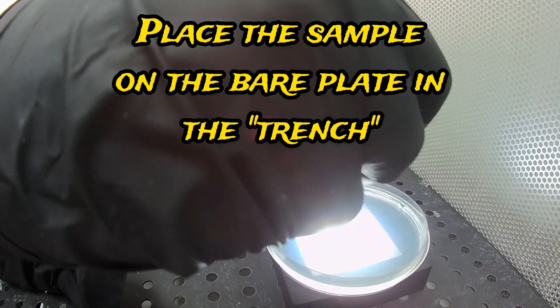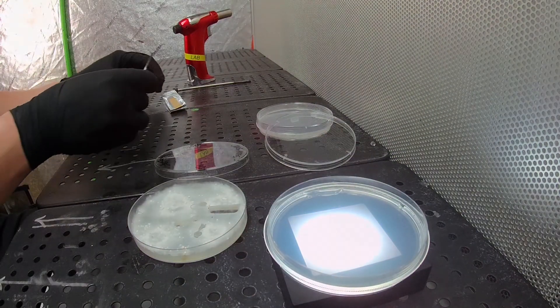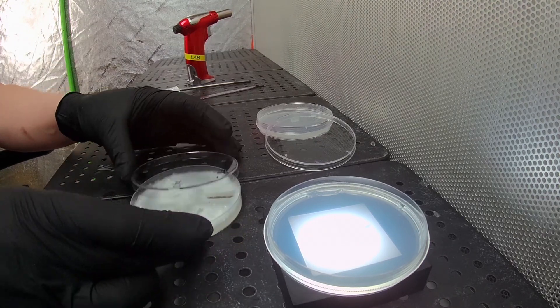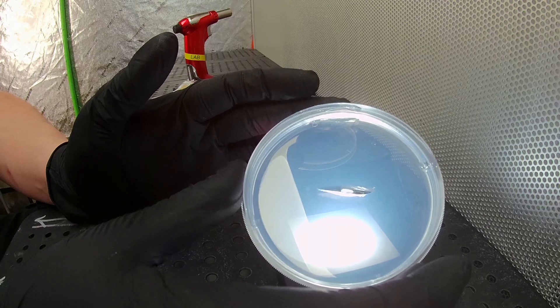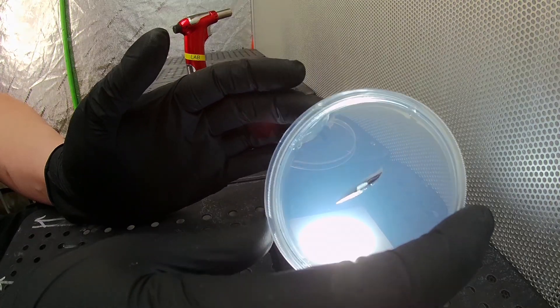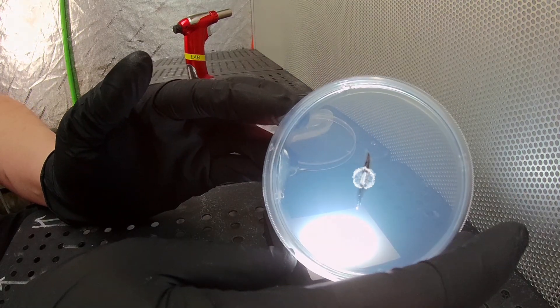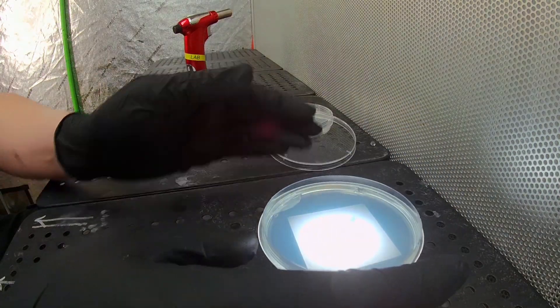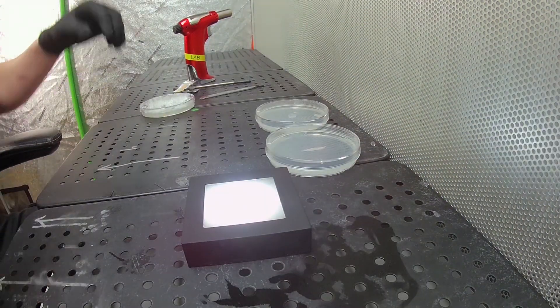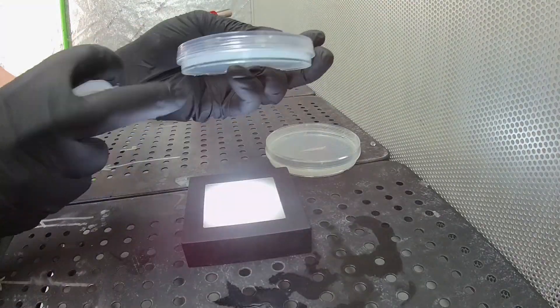The mycelium will reach out and the bacteria will stay behind on whatever part of the agar got left behind. When I lift it up, you can see it's centered as close as I can get it. The mycelium will grow outward and we just cut a little piece off when it does — and we're good to go. That's trenching. I hope you enjoyed the show.